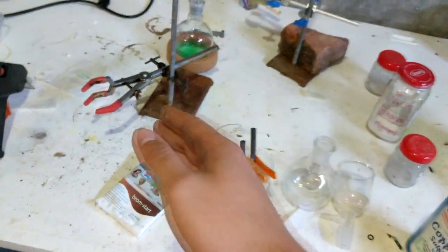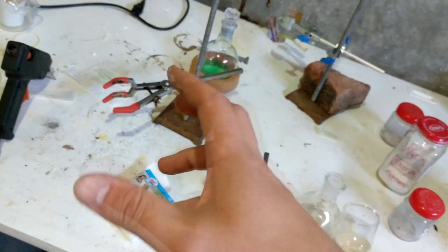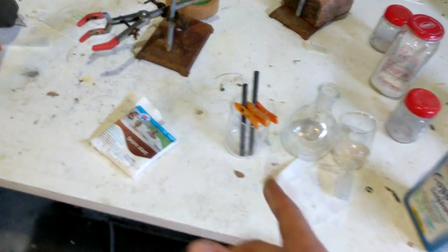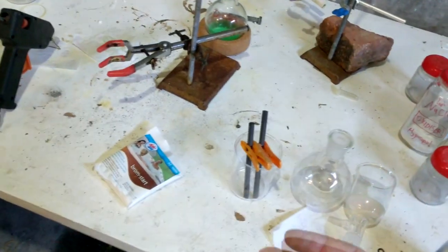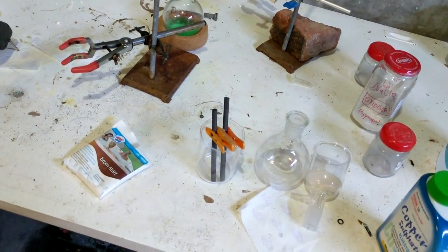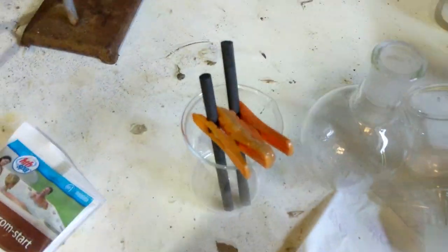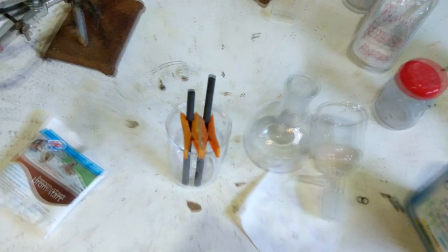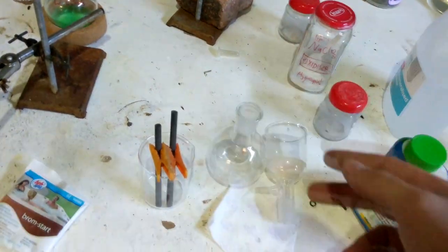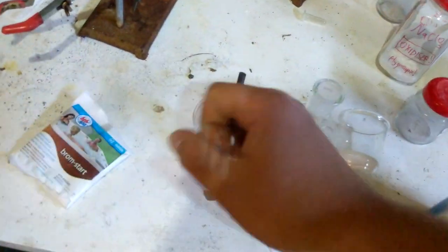A big difference from last time is that we used MMO-coated titanium electrodes. This time we can't use those fancy electrodes, which is a bit of a shame. The titanium that the MMO is coated onto doesn't survive bromide electrolysis. While the MMO coating itself does, any slight imperfections — which naturally happen, and happened quite substantially for me after the chlorate work — cause the titanium to corrode. So I've just gone with both graphite electrodes, very crudely hot-glued together. We can also just run it in a beaker, since we'll only generate a little bromine which isn't as volatile as chlorine, so we don't need to build a scrubber.